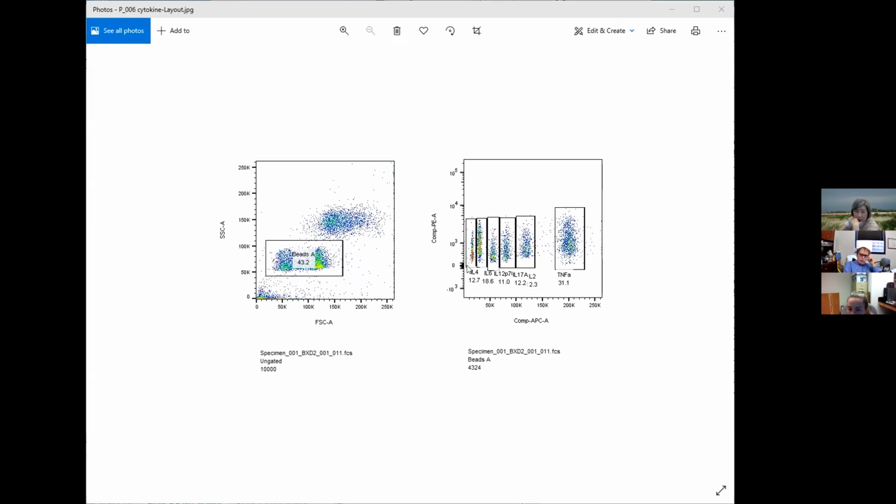Can you show me some results there? Oh, I see, you're showing it. Okay. This is the time that I did it like a month ago. Look at how much better it looked. Right. What's the number down below? What number? This? No, the 12.7 at the beginning, and this is 31.1.